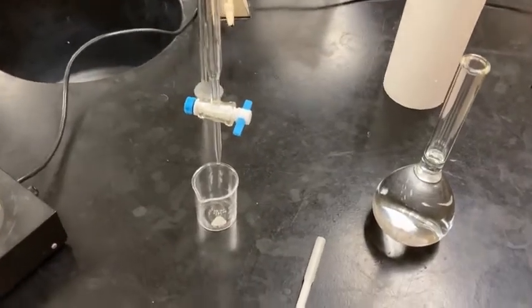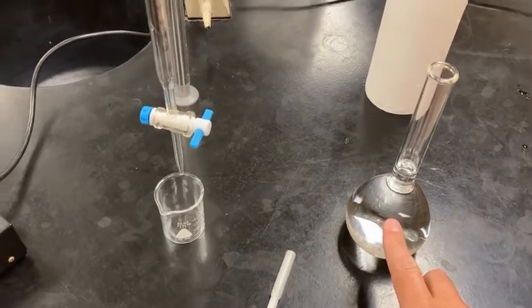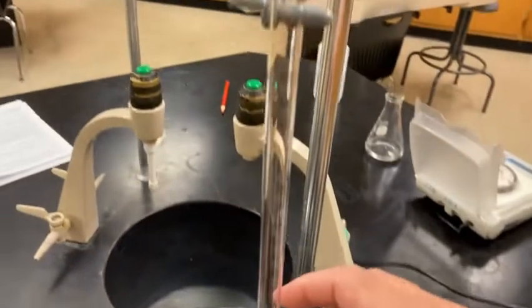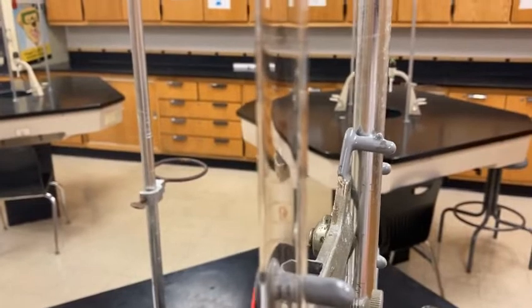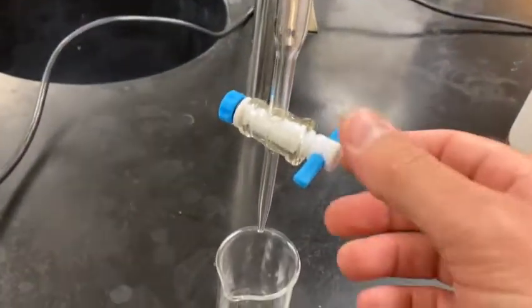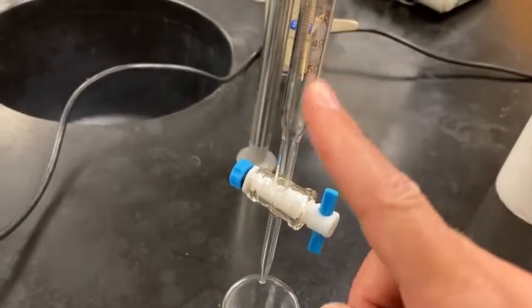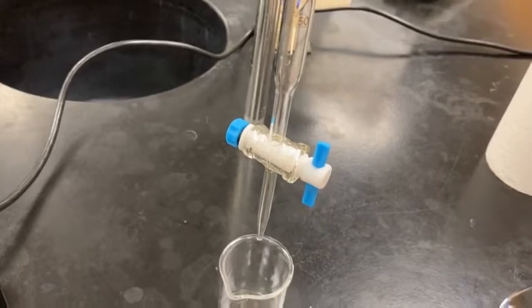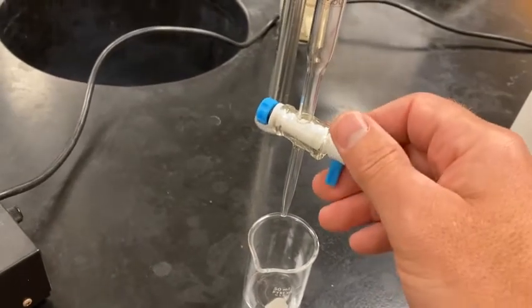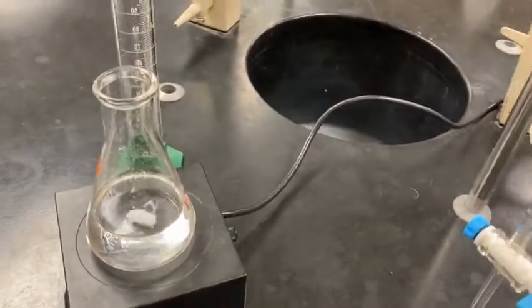Last thing we need to do to set up for our titration is to get the base that we want to figure out the concentration for into the burette. Notice the burette has numbers and increments on it that we're going to use to measure the volume of base inside that burette. There's also a little valve at the bottom. Right now it's turned off, but if I were to turn it this way, that would allow the base to travel through and out the bottom. And that's how I'm going to be adding my base to my acidic KHP solution that's mixing on the flask.